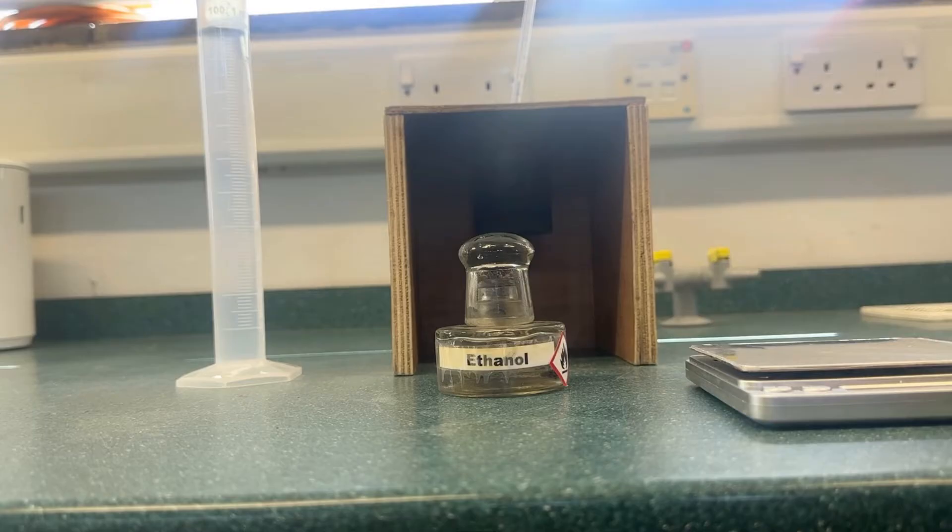For this experiment you will need the following equipment: a measuring cylinder, a metal beaker, a spirit burner of alcohol, a thermometer, a draft shield, and a balance.